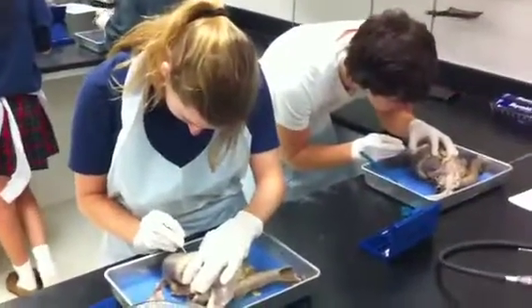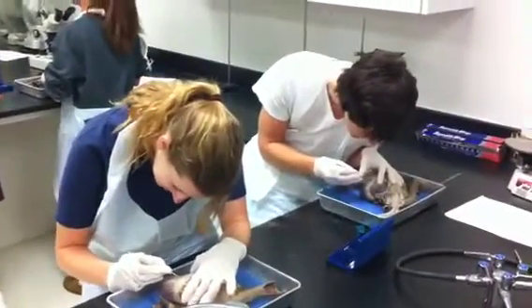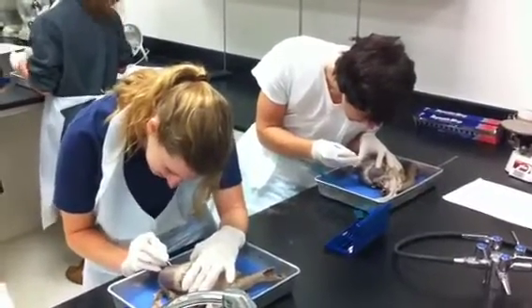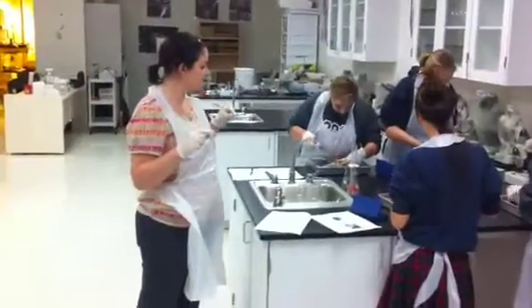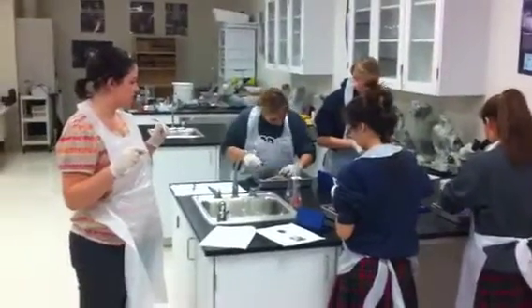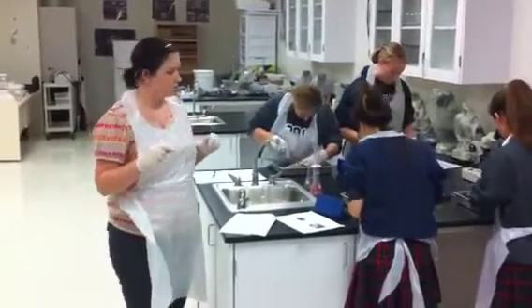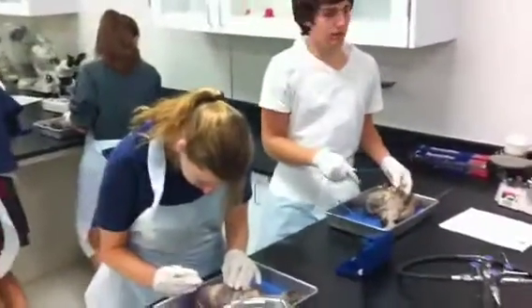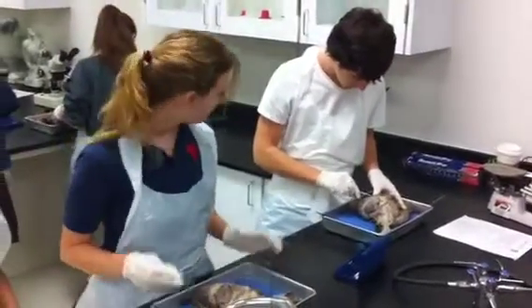You've got a lot of excess. It's like saran wrap — like vacuum saran wrap. One of the main things I want you guys to notice is that if you feel the vena cava and you feel the artery, you should feel that they're very different. One is very thick and hard, and one is very soft. The pericardium is just that really thin outer layer — it's hard to get a hold of. You don't cut to get to the pericardium. You just use your tweezers to pick it up, and then you start cutting.